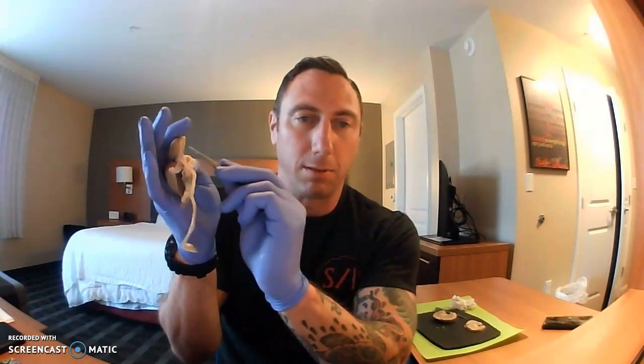You have the minor calyces, which I don't know if you can see it, but the minor, I believe, is the small white portions here, and then you have the major calyces, which are right in here. You'll have the renal pelvis, which is here, and then the superior portion of the ureter. This is the ureter here, so the superior portion would be right in here, which I'm touching with the forceps.